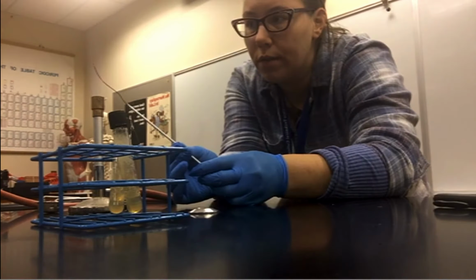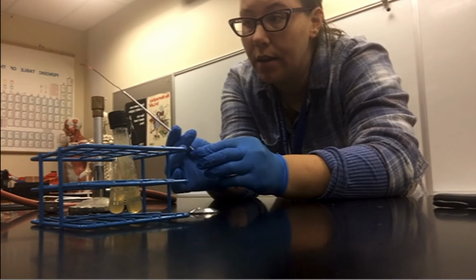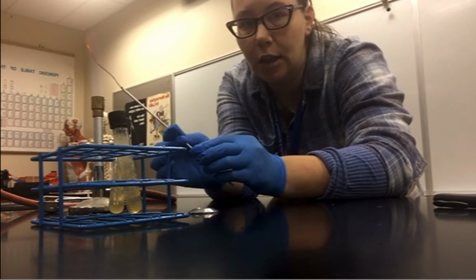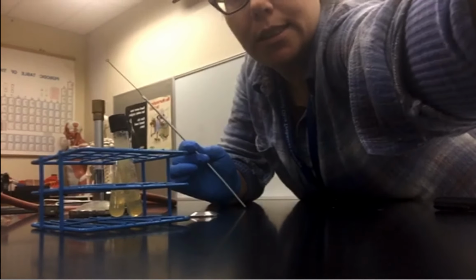Next lab, we'll investigate the difference between the gram-negative and the gram-positive. And again, it's not about presence-absence. It's going to be about more or less growth. All right, see you in lab.